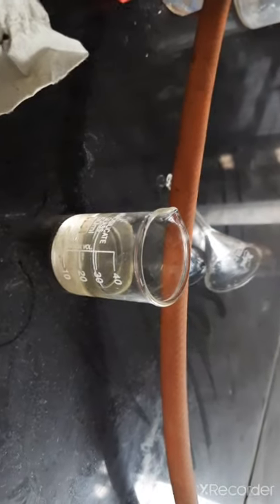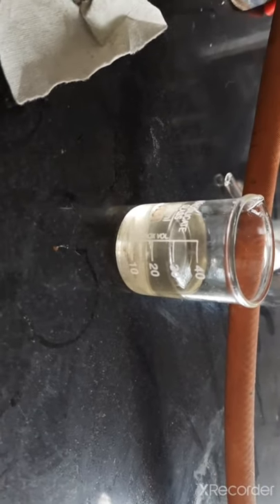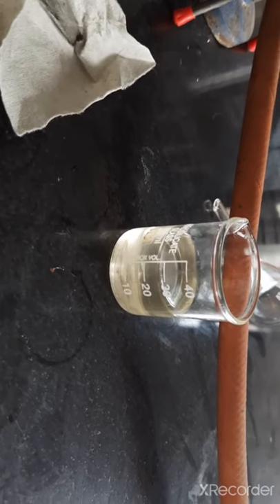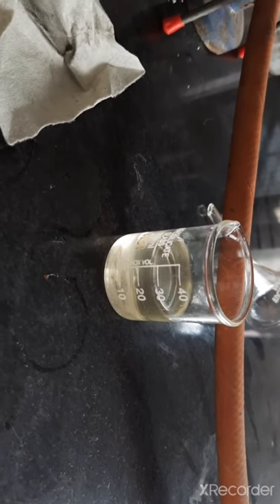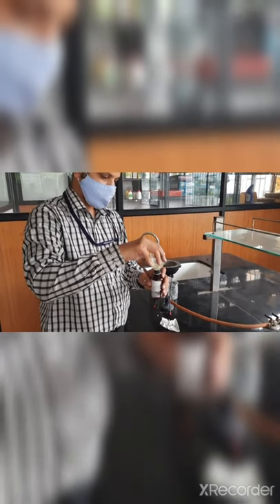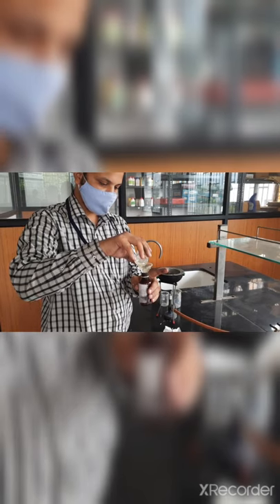We already had the liniment poured into the bottle. Here is our camphorated oil — I am pouring it into the bottle, and in that we are adding glacial acetic acid directly and shaking. I am pouring the liniment into the bottle. As you can see, it is all a clear liquid.